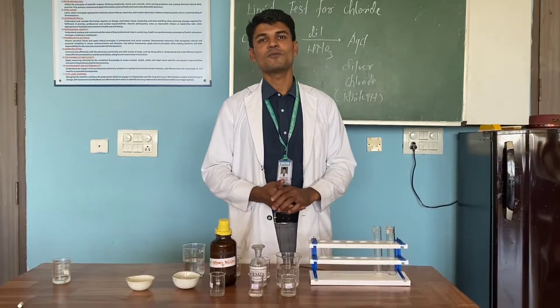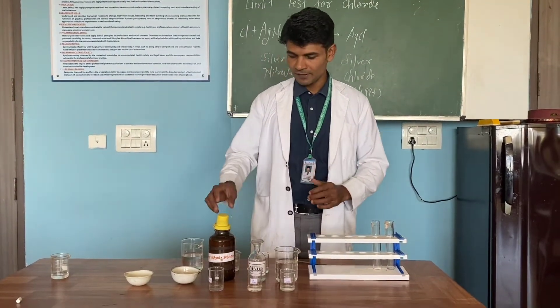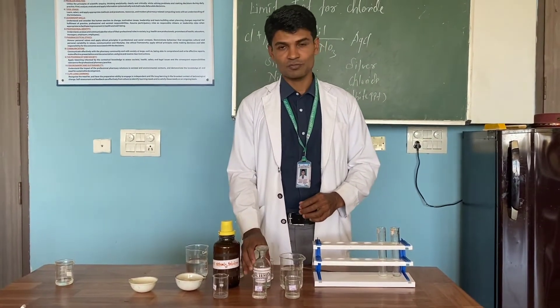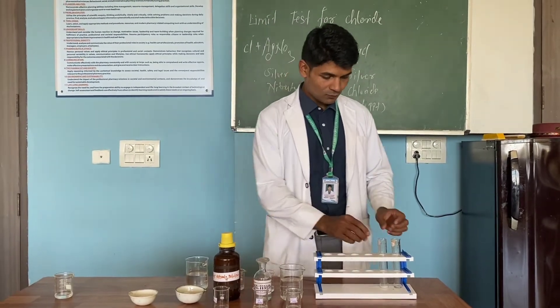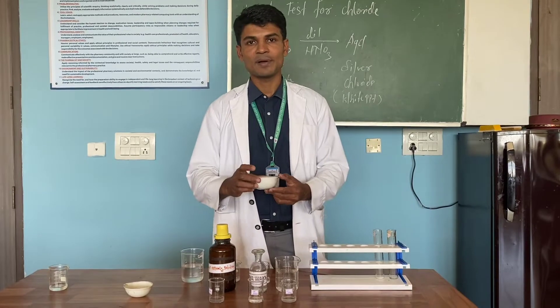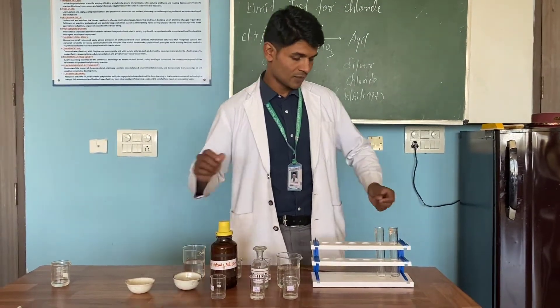So let's see how to perform the limit test for Chloride. To perform the limit test for Chloride, I have here silver nitrate solution, dilute HNO3 solution, a standard solution for Chloride, and sample A for which we will be performing the limit test for Chloride.